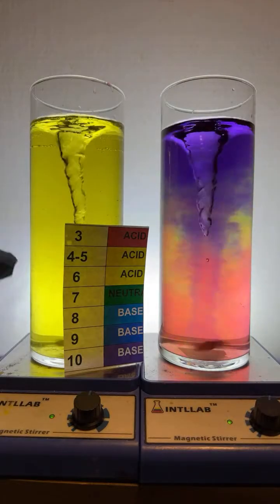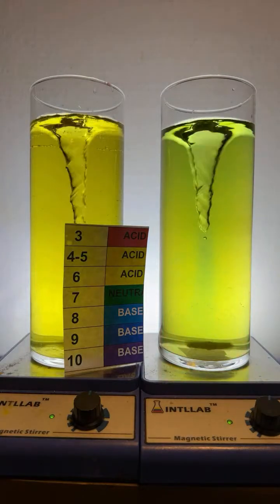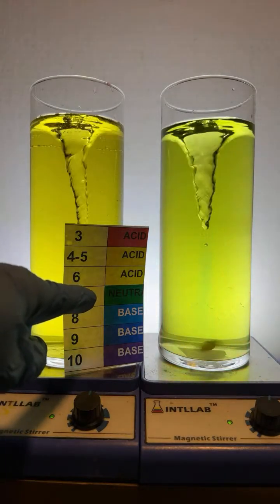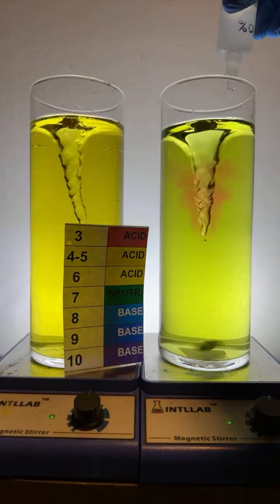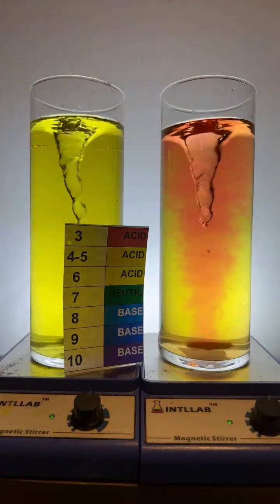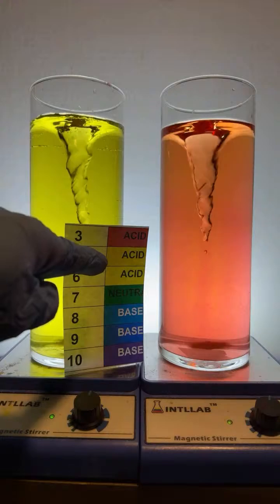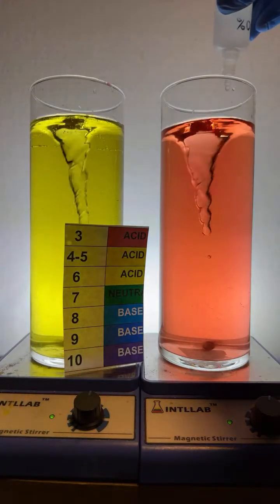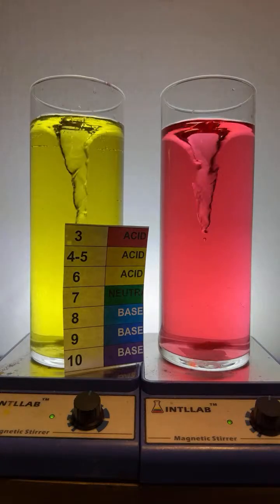That's because the acid neutralizes the base and brought us to a pH just below 7. So it looks like I have a little excess of acid. Let me add 2 more drops of acid over here. There they go. And now I've changed it from a pH 6 to maybe a pH 4 or 5. 2 more drops of acid, boom, boom, and there they go. And now I've moved from a pH of 4 down to a pH of 3.